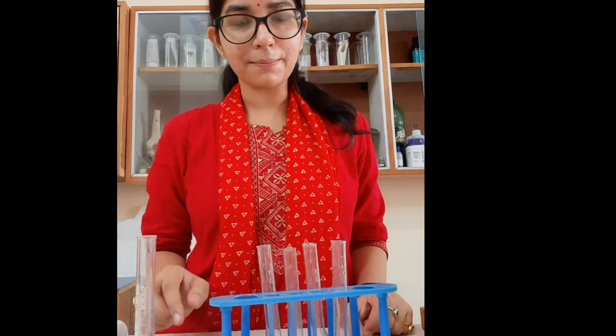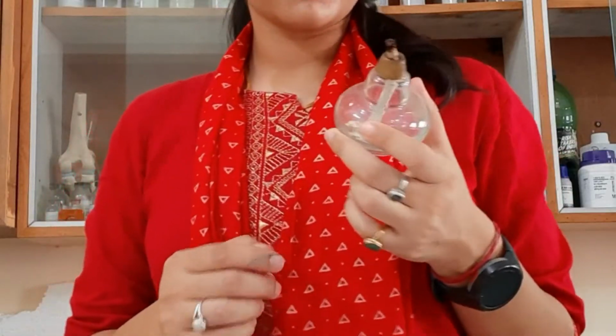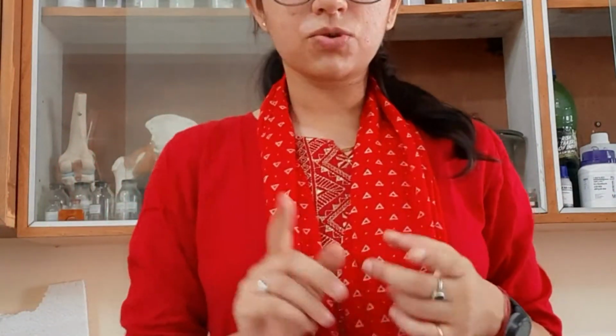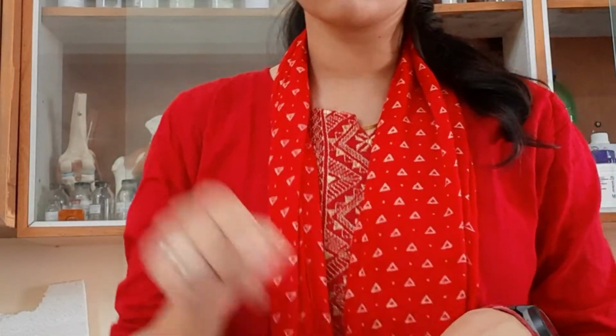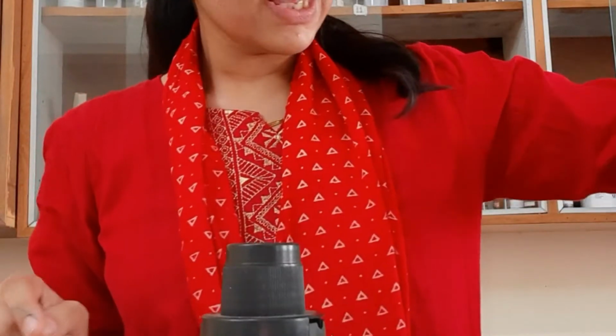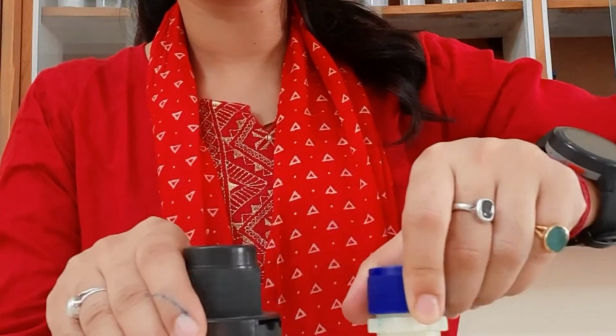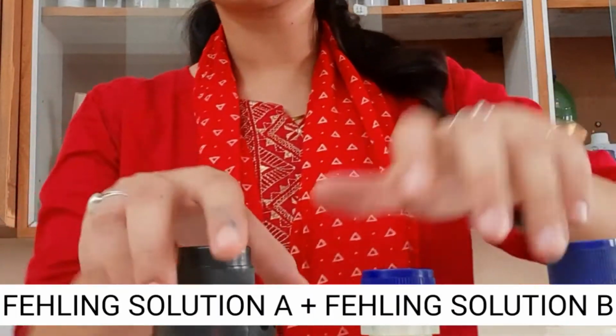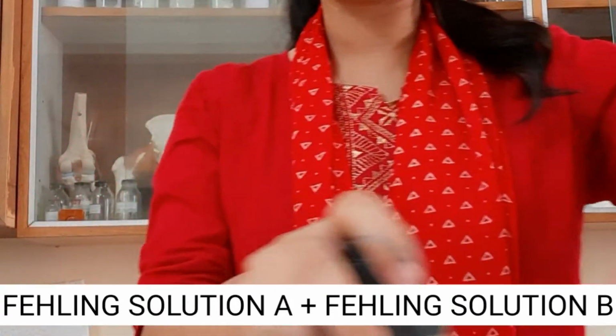Then we need a spirit lamp. But right now, as you can see, I do not have a spirit lamp, so I am going to use the candle for the boiling purpose, right? So what are our requirements? We need a test tube stand, glass test tubes, a measuring cylinder, and because we are going to perform Benedict's first, we need Benedict's solution. Then we will do the Fehling's test, so we need Fehling's solution. Fehling's is in 2 forms, Fehling's solution A and B. So these 3 reagents are the materials which we require for today's experiment, right?